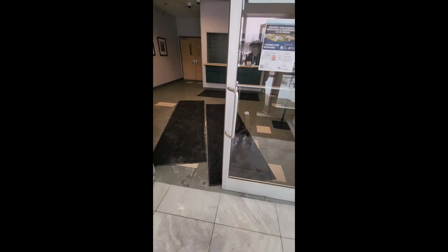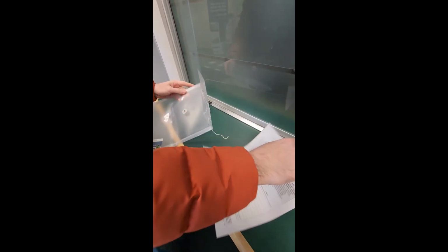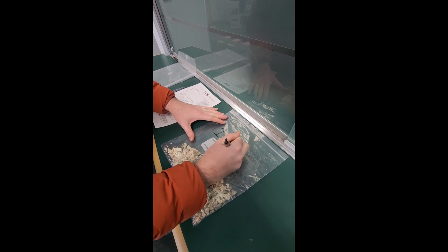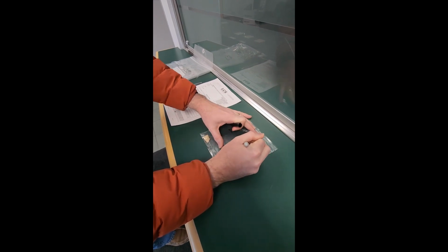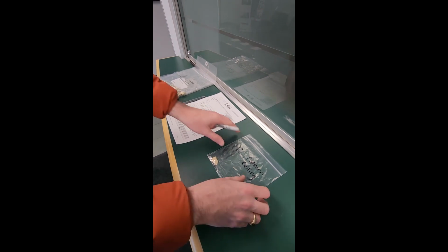If you want, you can do the next steps either at the drop box or in the main lobby of the building. Start by opening the envelope and taking out the provided test request form and one of the provided pens. Using a Sharpie or a marker, make sure to label each of your samples. Label and number each sample with how you would like the samples to be called in the final report. Once all your samples are labeled, set them aside for now.